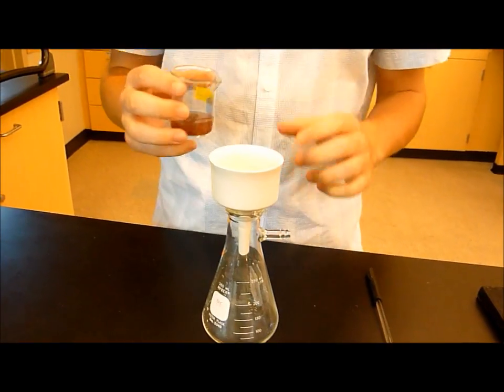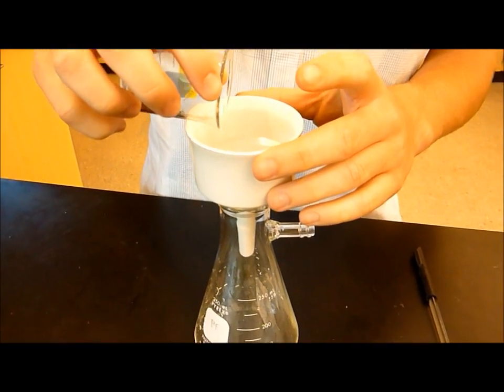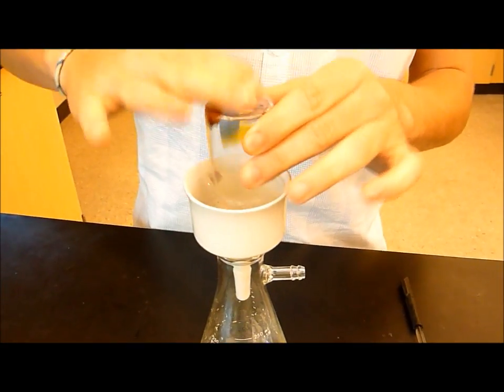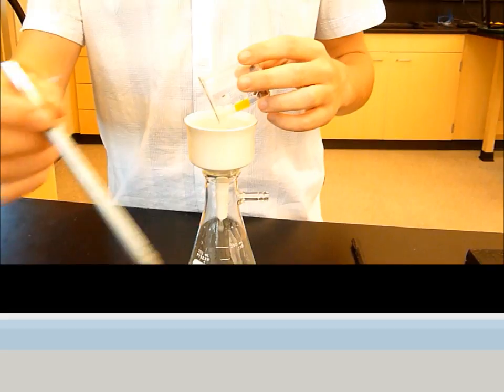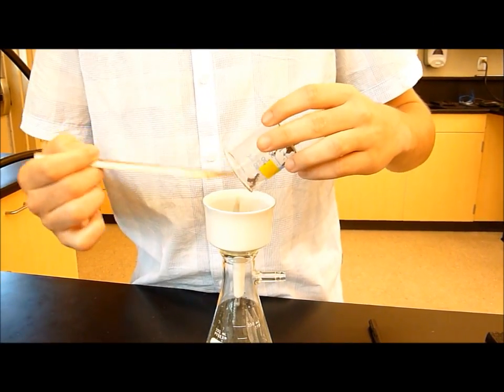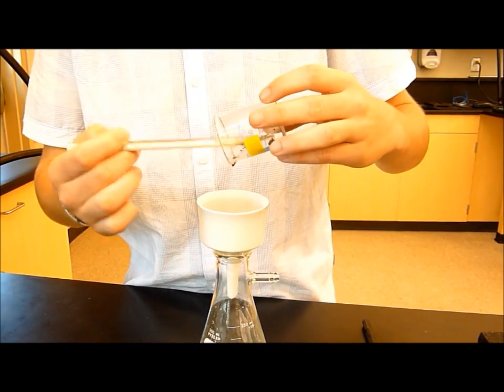So, you just take your solution and you gently pour it onto the filter. And you just want to get as much of the copper out as you can.